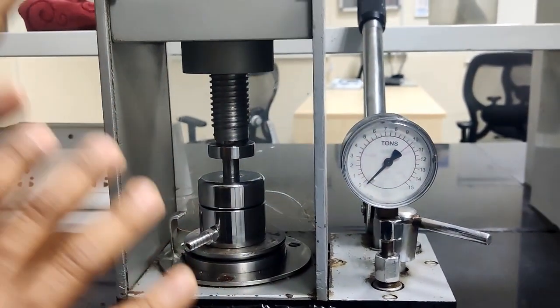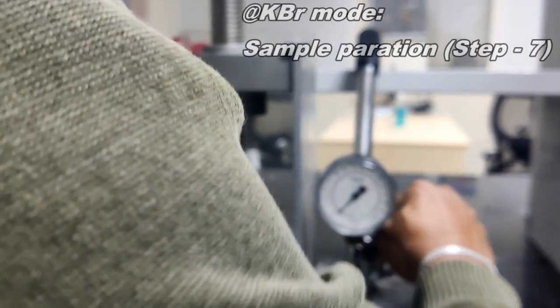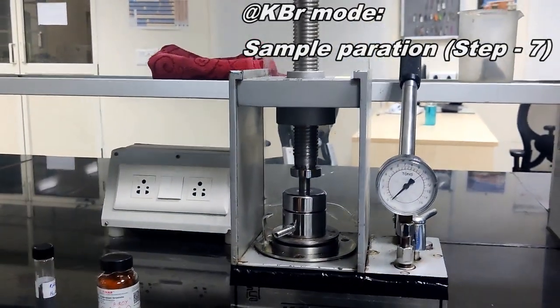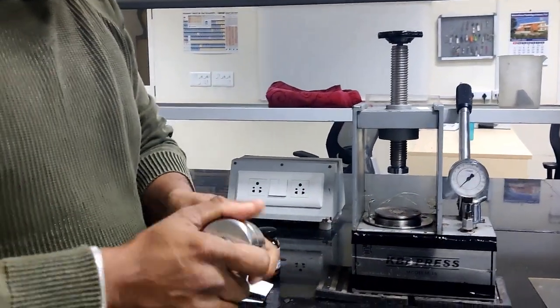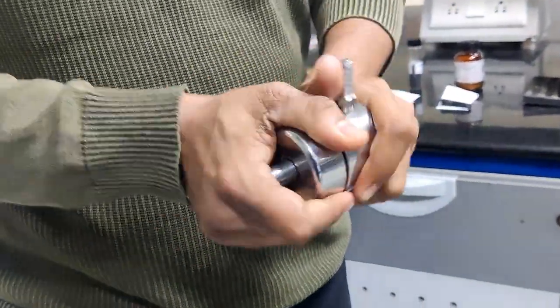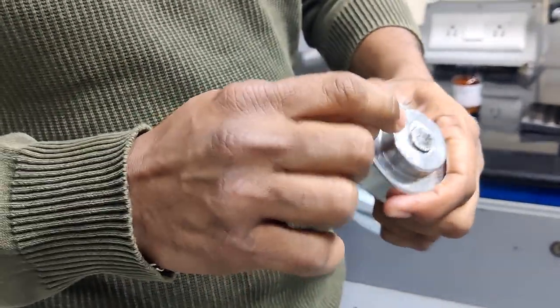So now we can open the die from inside the press, so we can take out the pellet. We just have to rotate this one, and the die will come outside. We have to rotate slightly like this, the base and the upper one. Now this is the cavity, actually, so the prepared pellet will be inside.